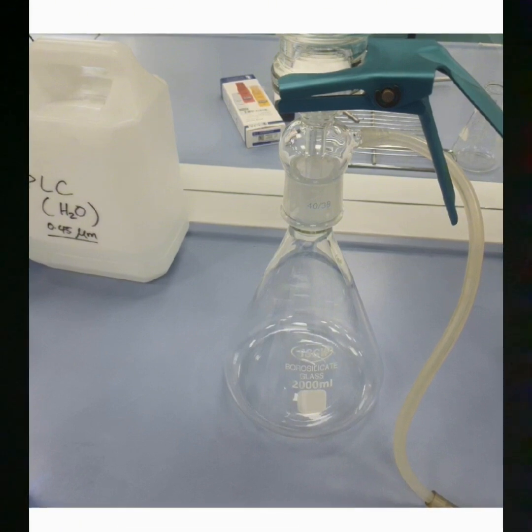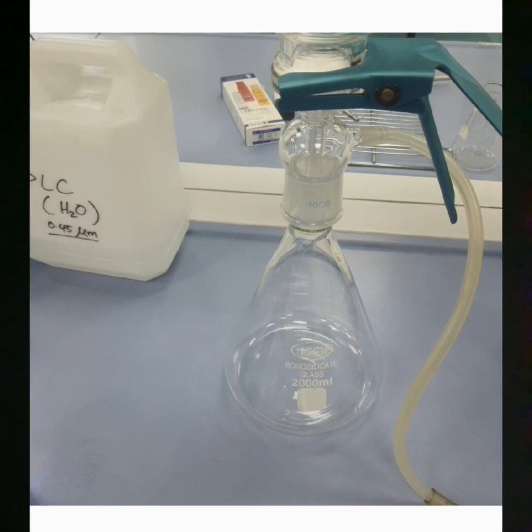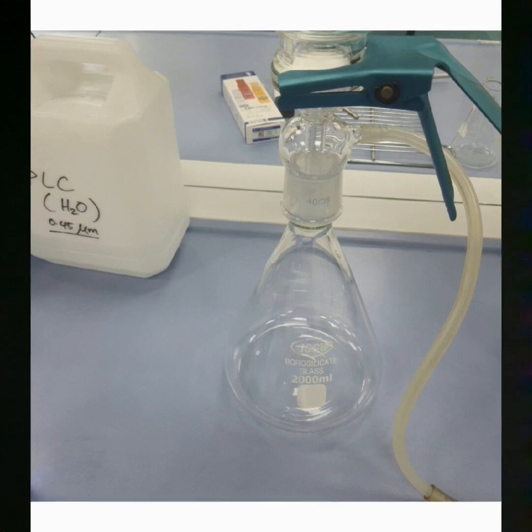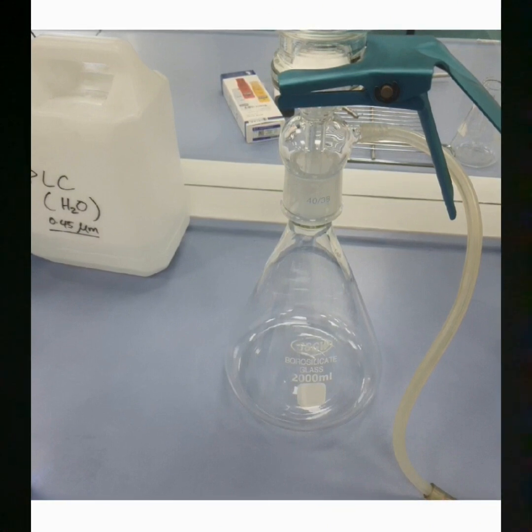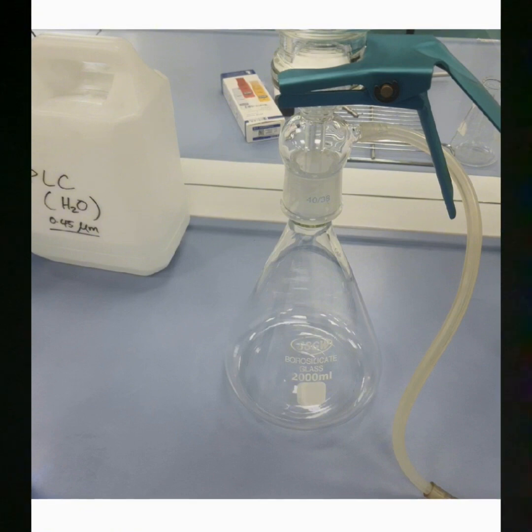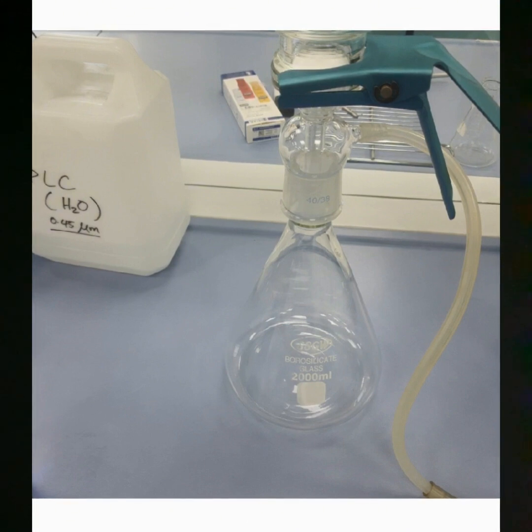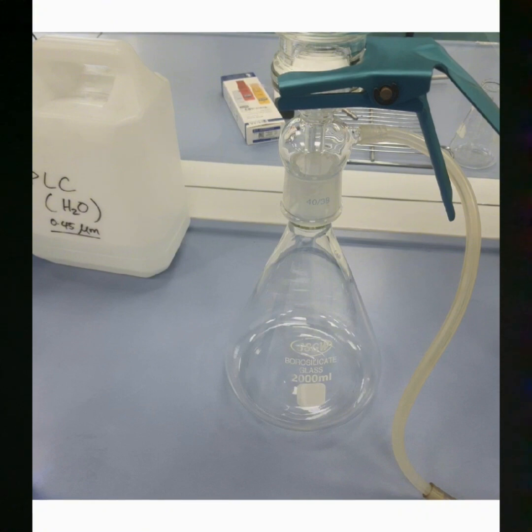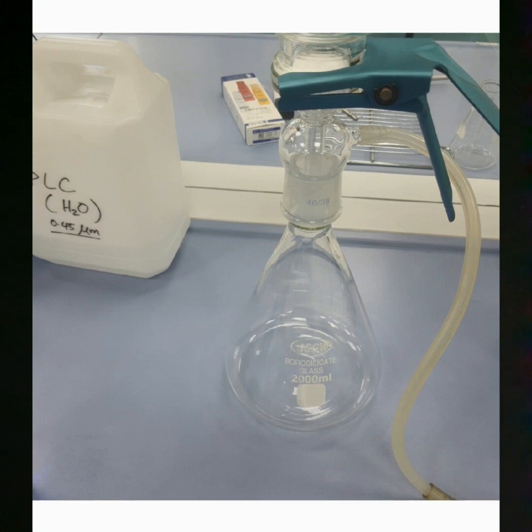In the vacuum filtration device, we use a membrane filter, a microporous membrane, a filter cup which can hold a sample in the range from 100 ml to 500 ml, a triangular liquid collection bottle where you will get the filtered sample, a sand core filter also sometimes, and a fixed aluminum clamp from where you can clamp the sample holder to the vacuum filtration system.